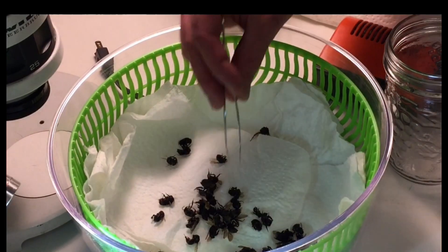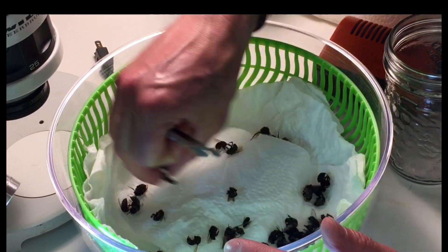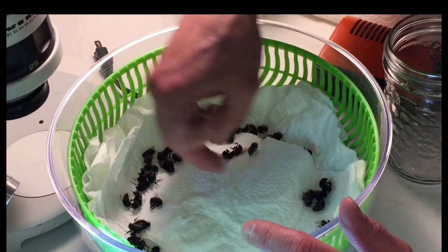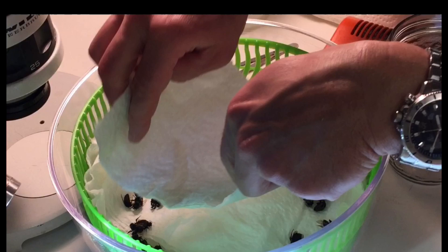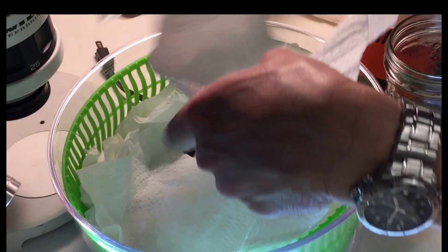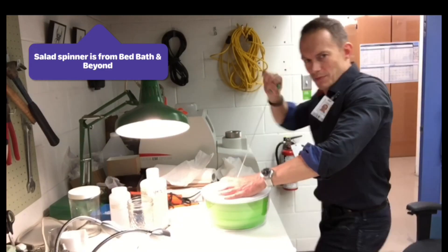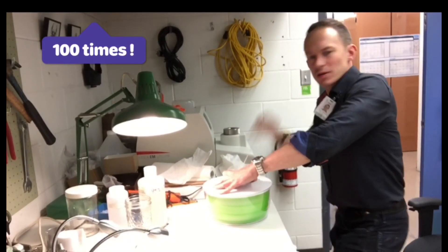I'm going to arrange the bees in the salad spinner using forceps, moving them around to the edges. It acts a bit like a centrifuge really, and it'll draw the moisture away from them into the paper. Then you want to put some paper over top to stop them from moving — just gently use more paper towel and trap them in there with some layers like this. This is the fun part — spinning the bees. I got the salad spinner from Bed, Bath and Beyond. I want to do this about a hundred times.